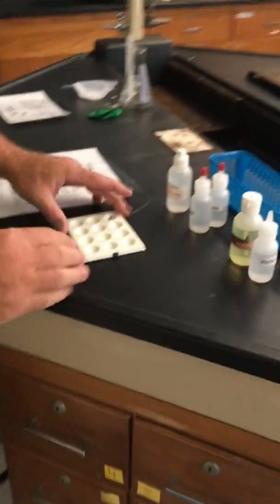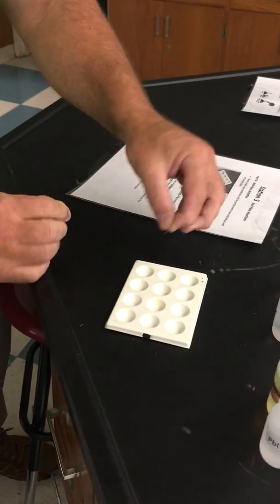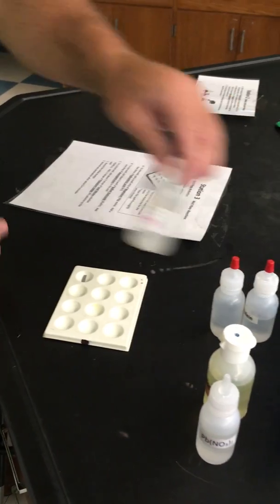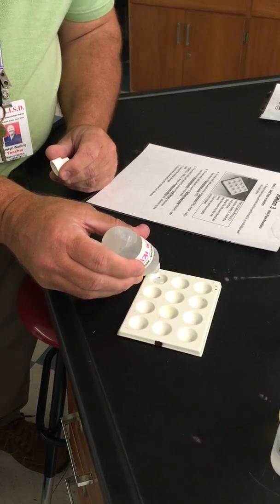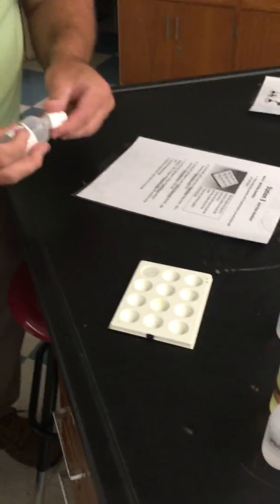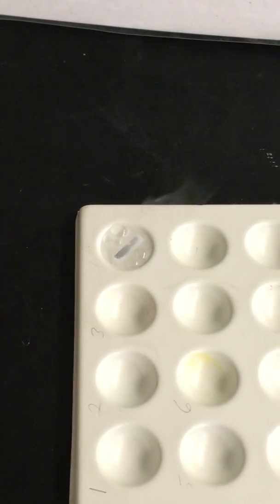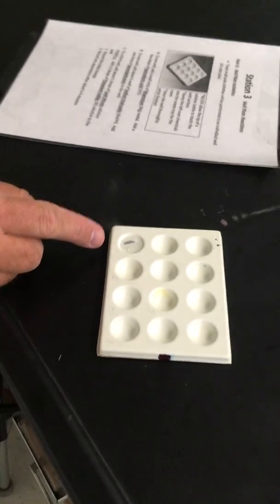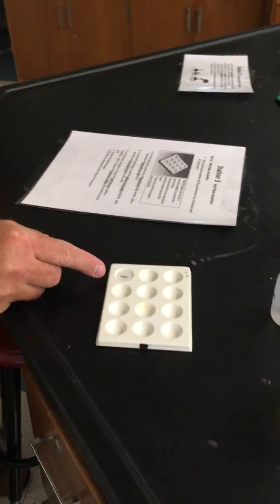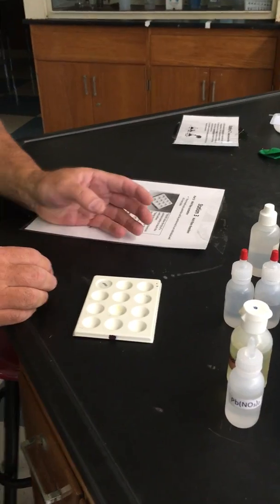In station 3, we're doing 3 simple micro well reactions. In this well right here, I've got 1 small piece of magnesium metal. And what I'm going to do is put several drops of hydrochloric acid over it. Miss Hallie's going to get really close. You should notice a lot of vigorous bubbling as the acid is reacting with the metal. We're going to give it a little bit of time, and we'll come back and look at it in just a little bit. But gas formation should be a sign that something chemical happened.